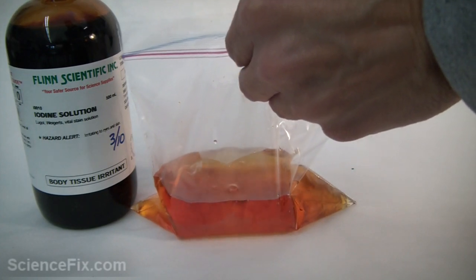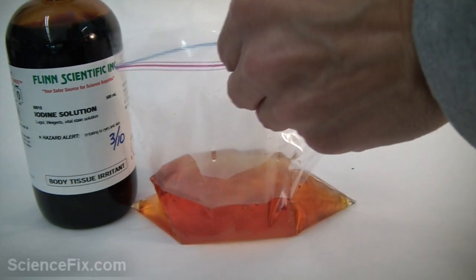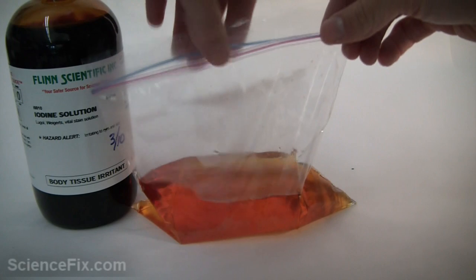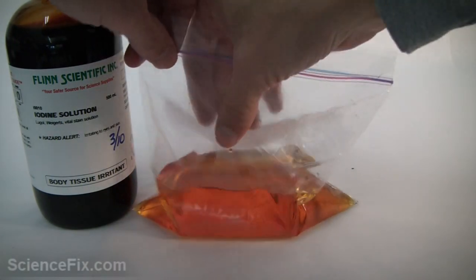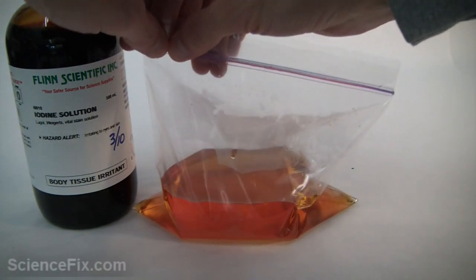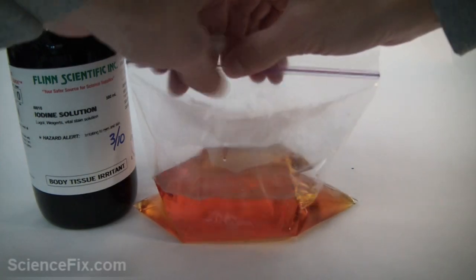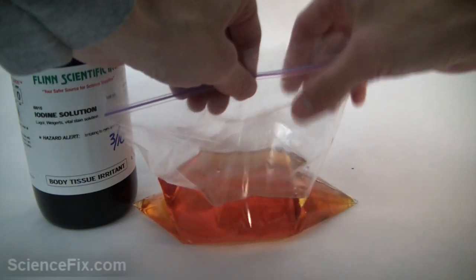We are going to seal up the plastic ziplock bag, and when we do that we notice that it doesn't look like any of the water or iodine can pass through the plastic material. It doesn't seem to be leaking.